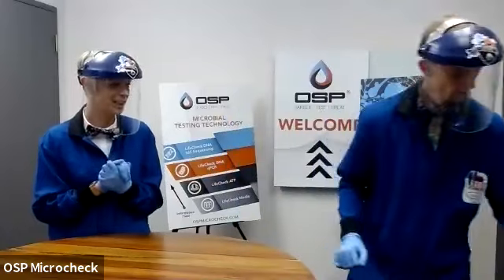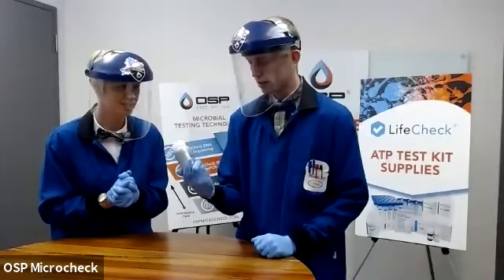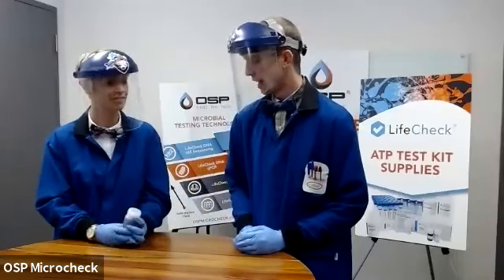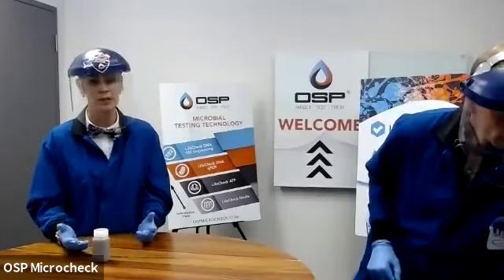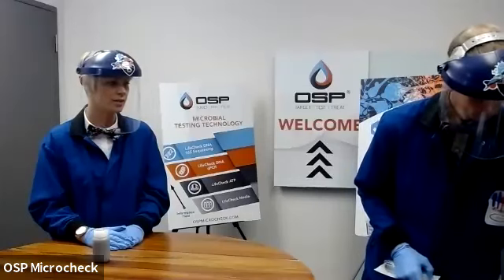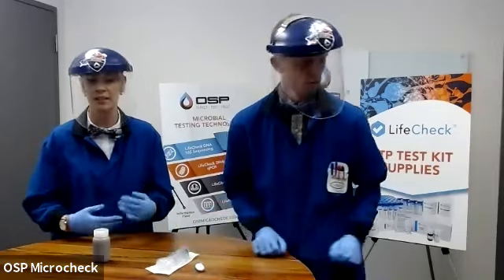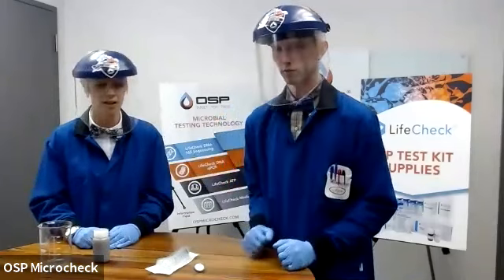So what are we testing today, Mark? Well, we're going to start off with that planktonic test matrix. So we have a liquid sample here, labeled sample. And we are going to enumerate the active and living microbial load in this sample using our planktonic ATP kit. Okay. So when you order these kits, they'll come with all of the disposables, the plastics, the reagents. So everything that we're going through here today, we'll do our best to highlight the name of it. I'm not sure if you'll see very much of it with the camera angle, but you can correlate it right back to the kits based on which one you are purchasing.